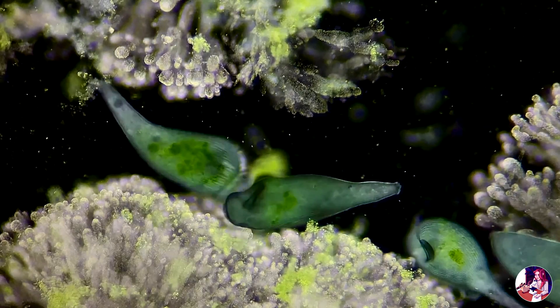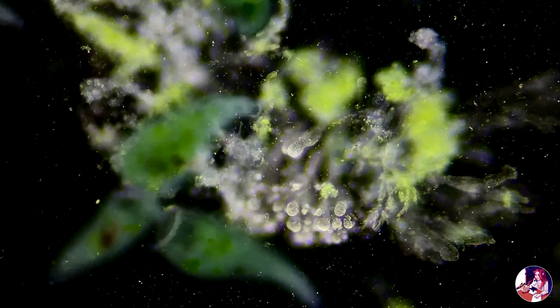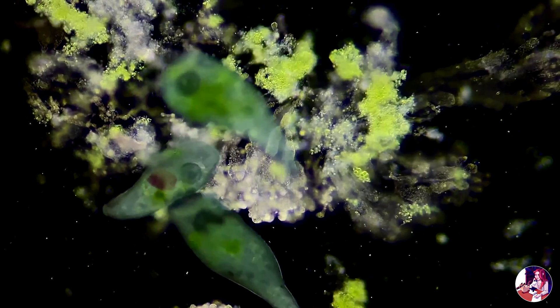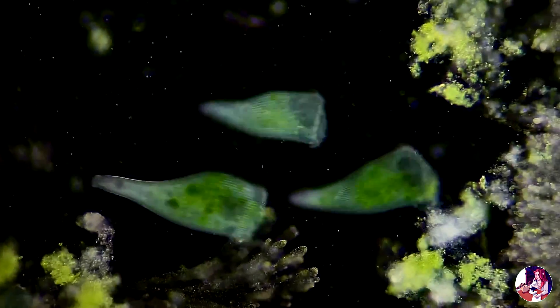When threatened, the stentor can release a toxin from its stentorin, the blue-green pigment, and this toxin can cause a predator to retreat, giving S. coeruleus a chance to escape.